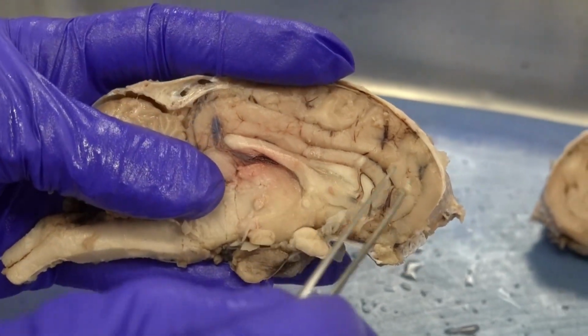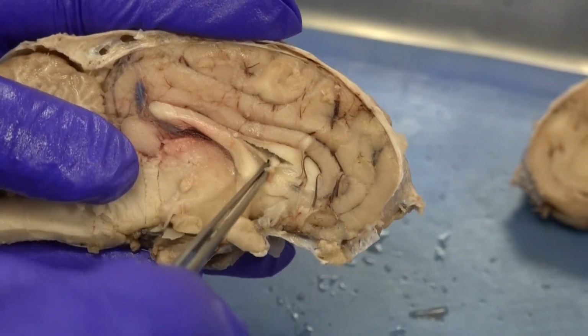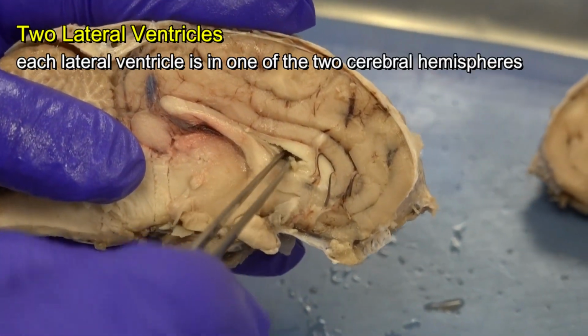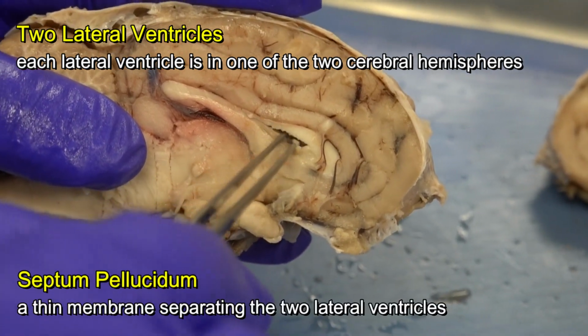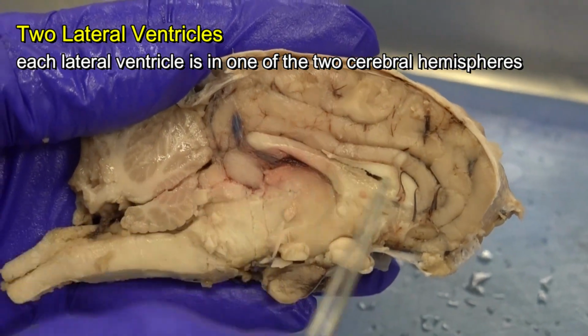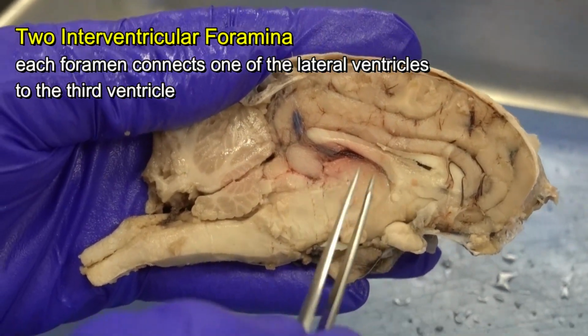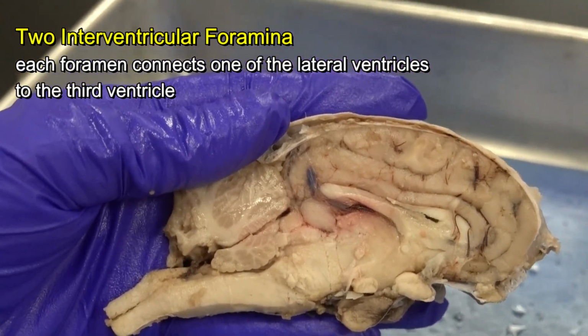So I go inside the cerebrum, deep inside, I find this space. That space is the left lateral ventricle. Recall, we have two lateral ventricles. Each lateral ventricle is located deep inside one cerebral hemisphere. It is connected to the third ventricle by a foramen that we call the interventricular foramen.